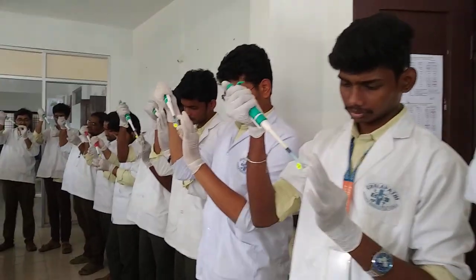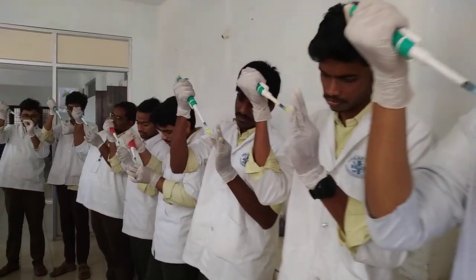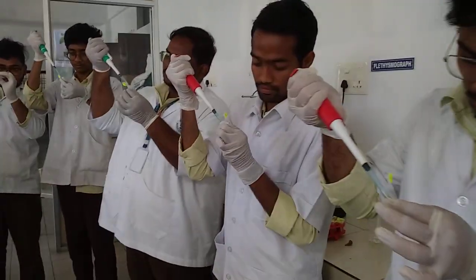All cells should be broken down. Take the tip in and out, in and out. Repeat as many times as you can do, without making bubbles, without losing the liquid. Take liquid.